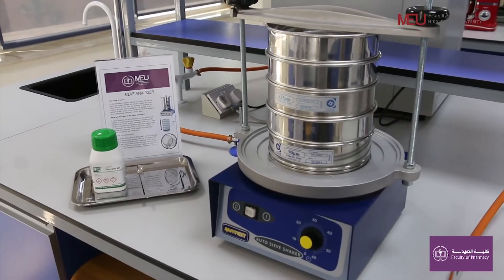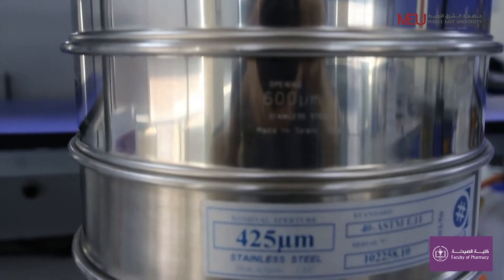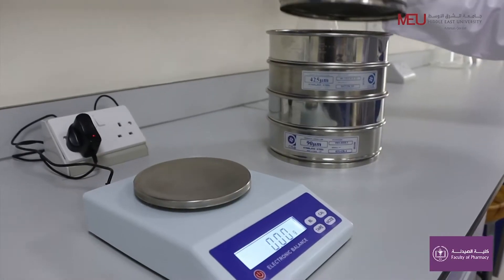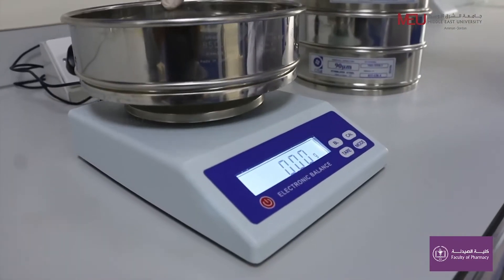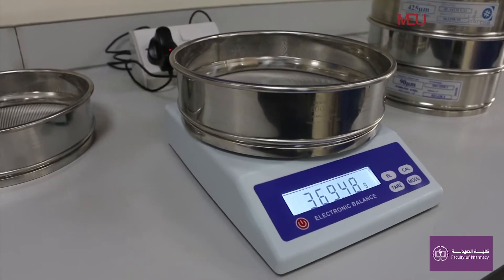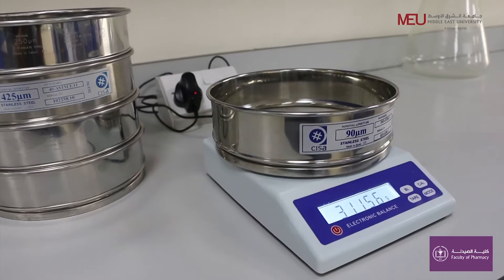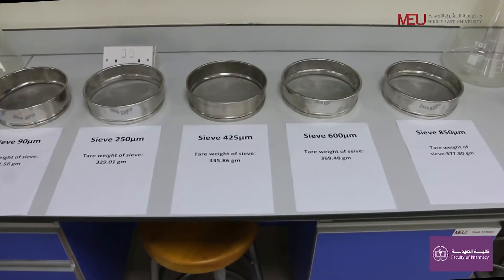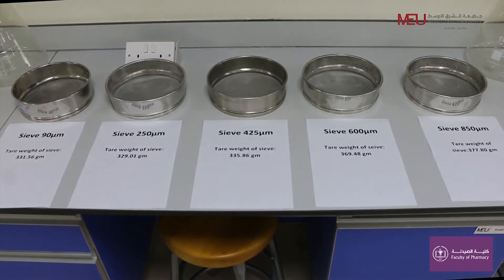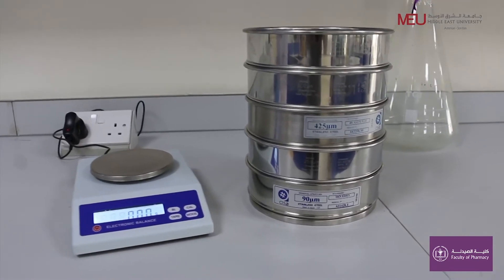Now we will start our experiment. Obtain the appropriate sieves and measure the tare weight of each sieve. Sieves should be arranged in descending order.